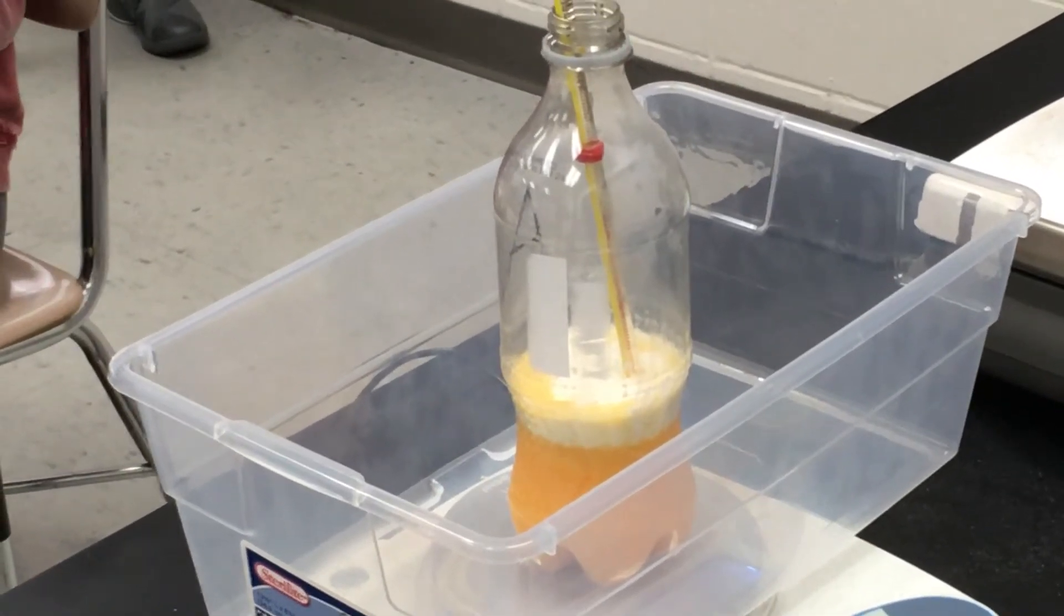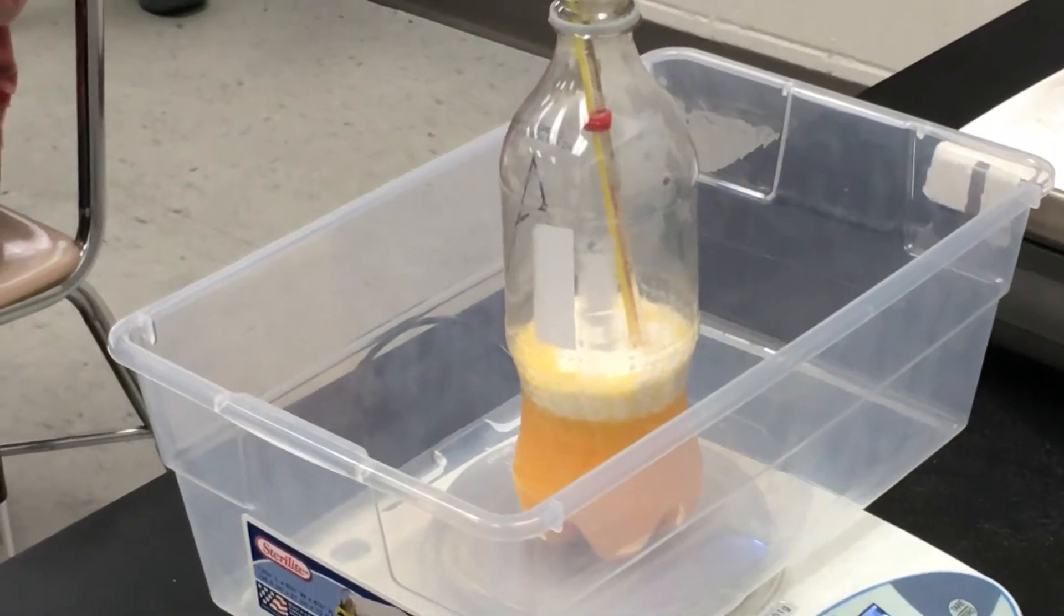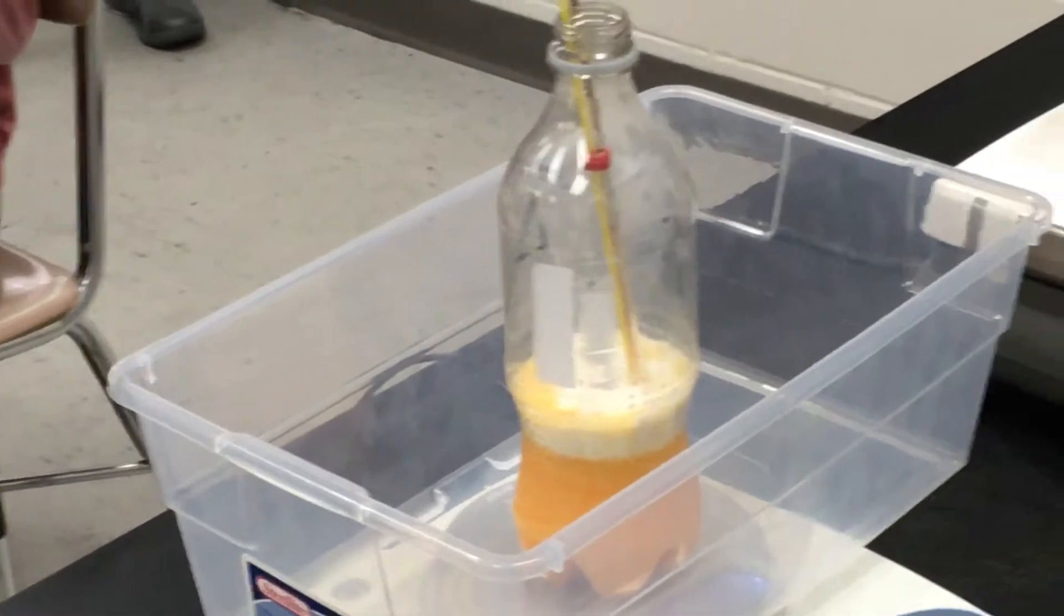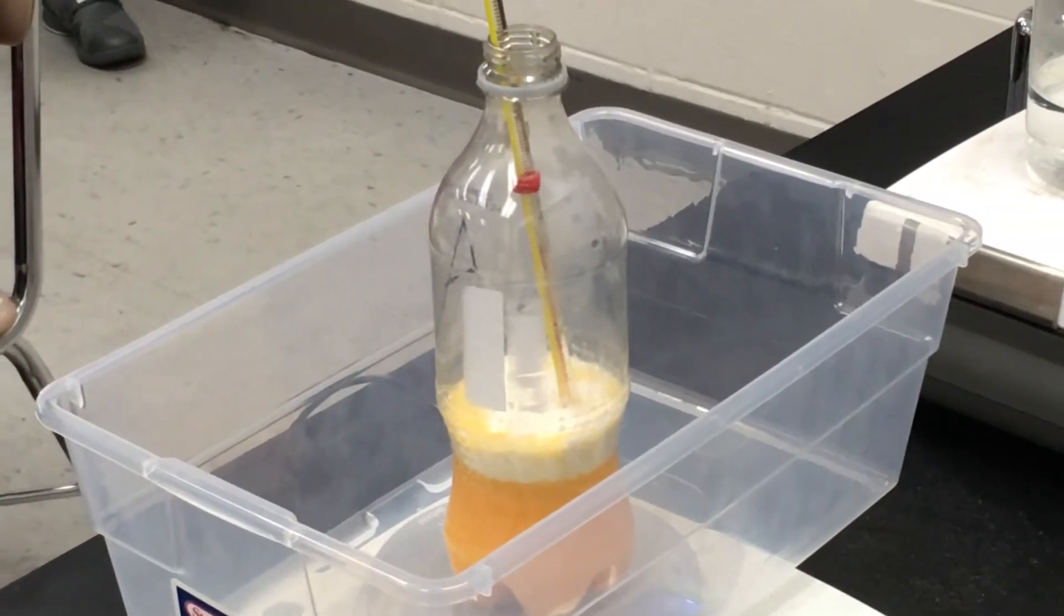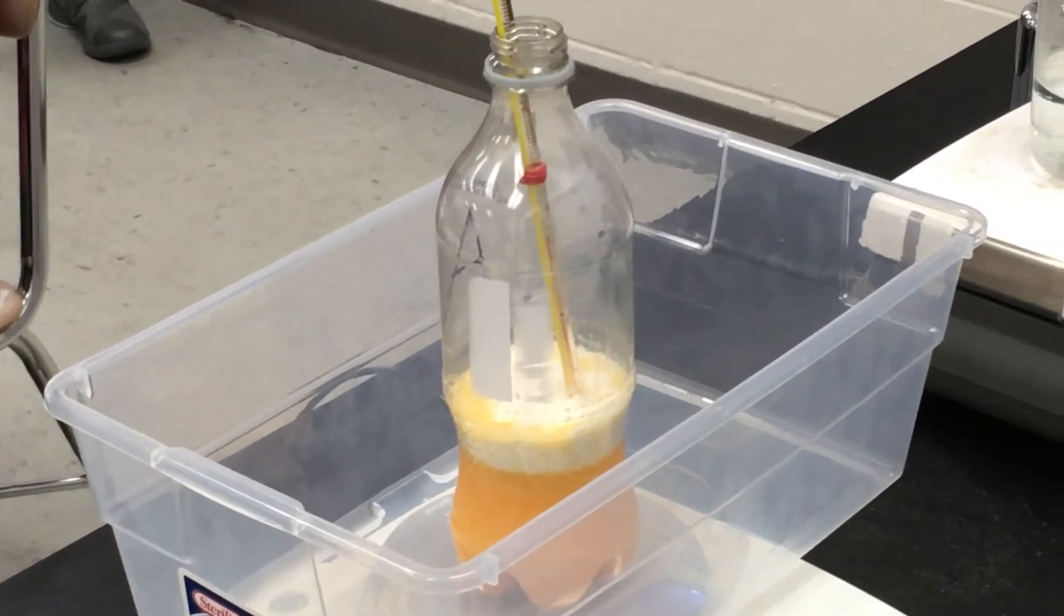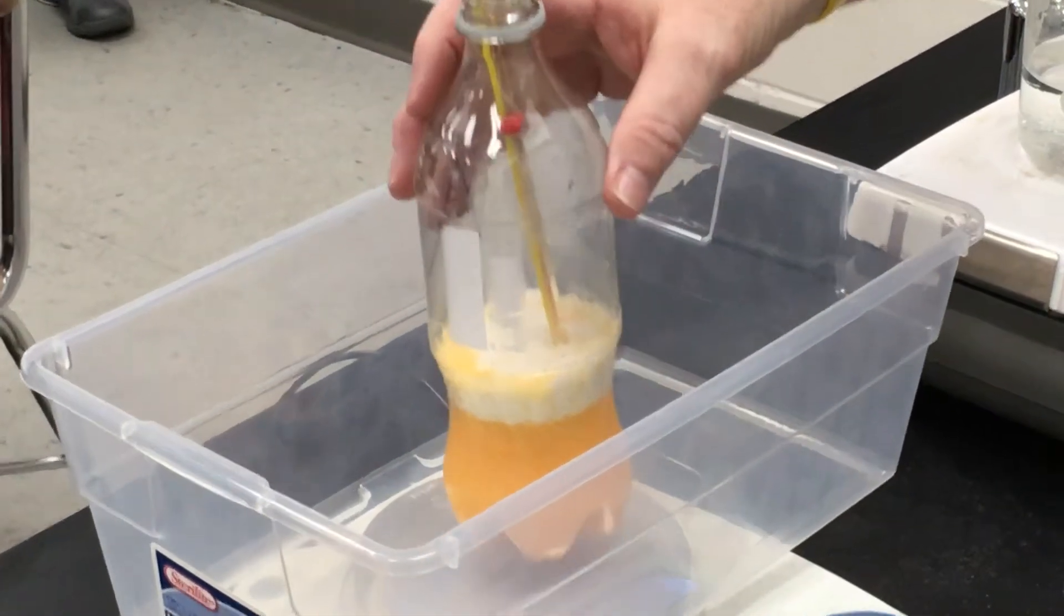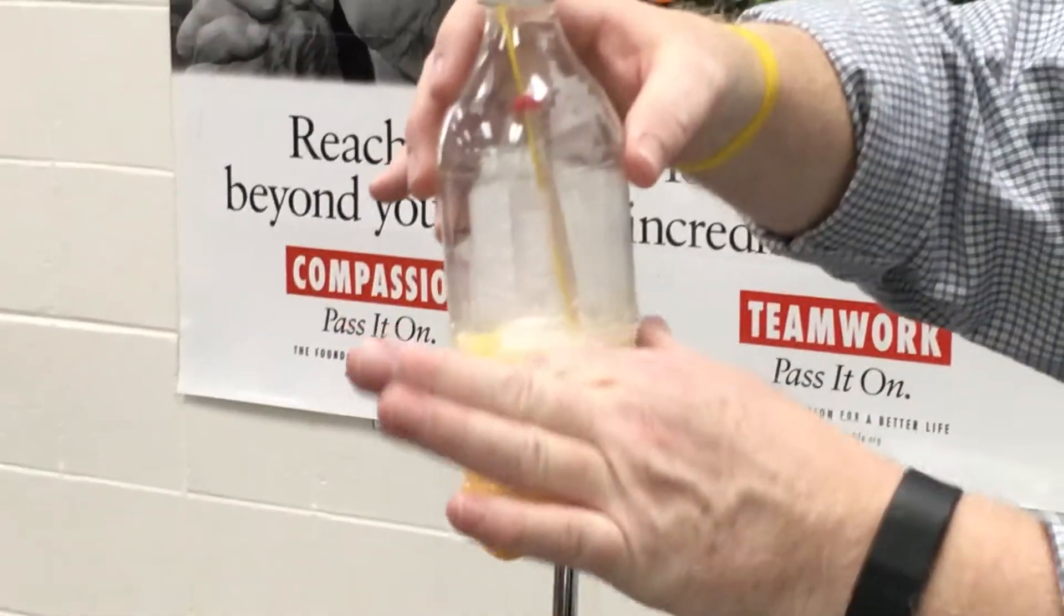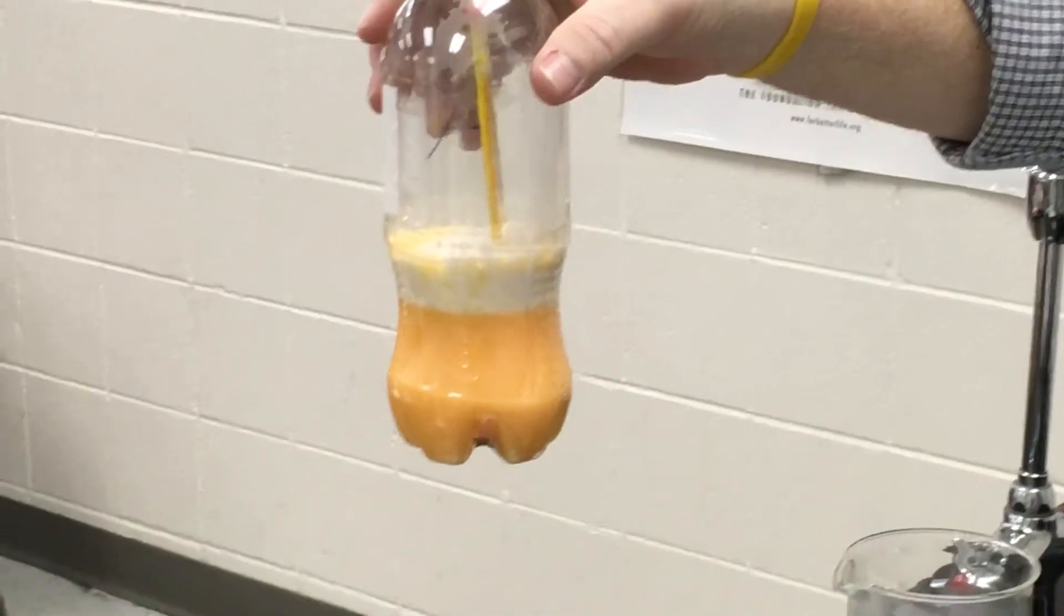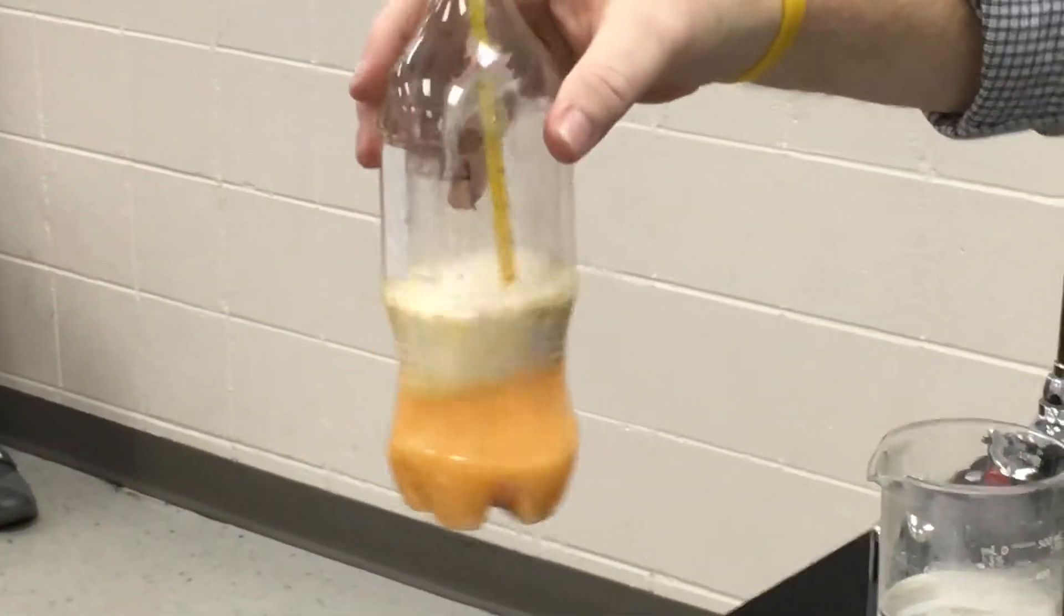Guys, things take time, it's starting to grow. Now, I can do one thing that will definitely - I'm going to lift it up. Guys, what is one way that I can increase the rate of the reaction? Stir it up. Stir it. So I'm going to do this.